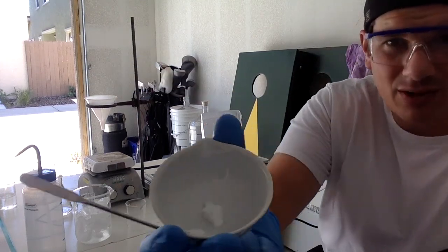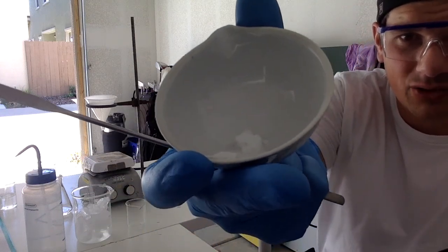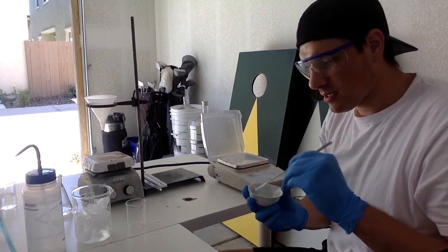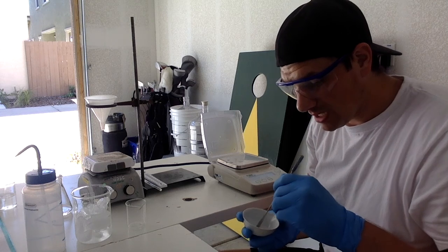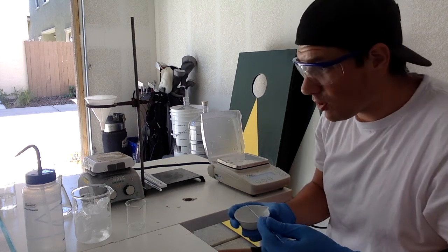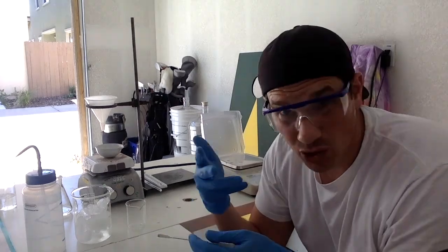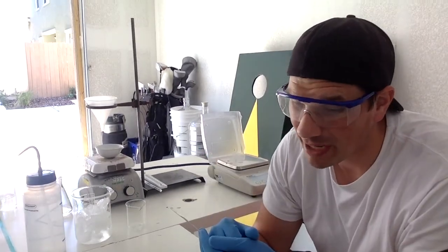Here's what it looks like right now. So you can see those aspirin crystals that are in there. Don't want to drip anything. So what I'm going to do is kind of suction off any of that solution in there because the crystals will stay behind. So I'm going to try to suction off all that stuff. Otherwise, what I can do is I can place it on my hot plate and I can recrystallize it, and then once it's all cool, I can get the brand new mass. In fact, I think I might do that.